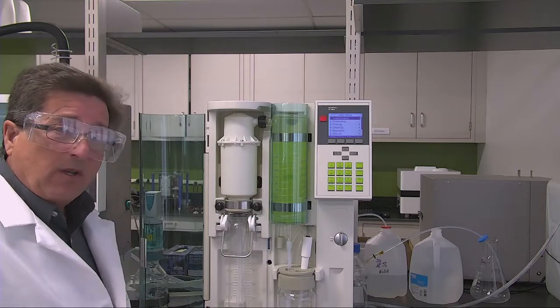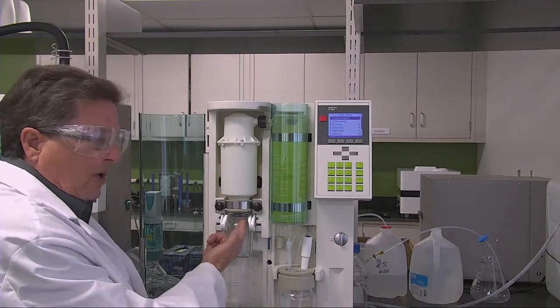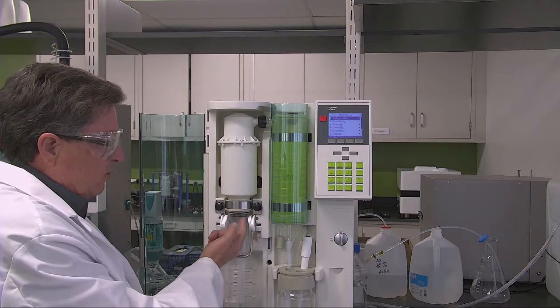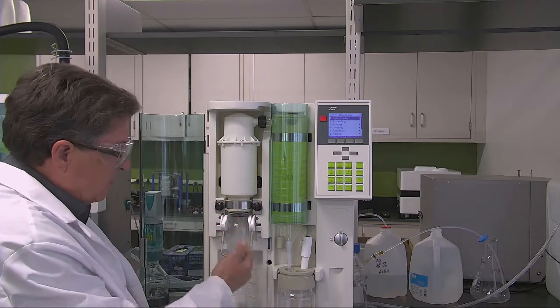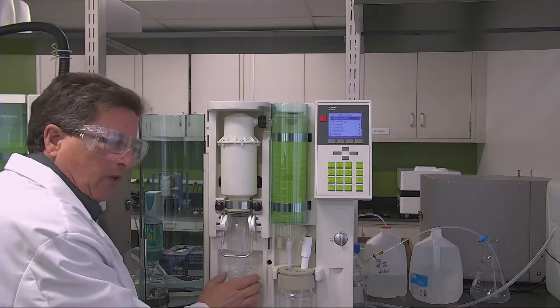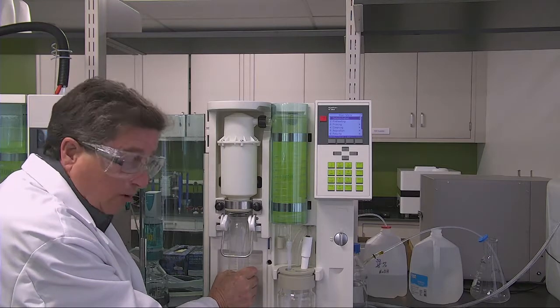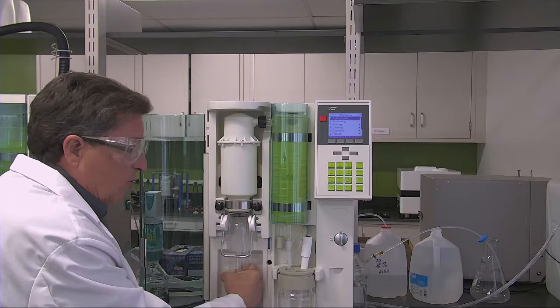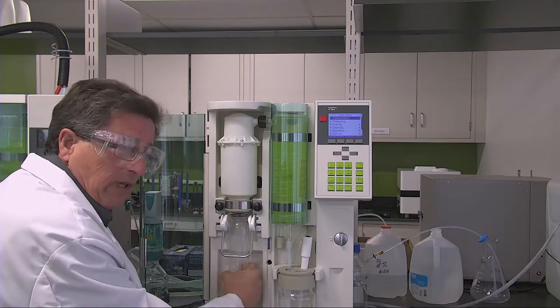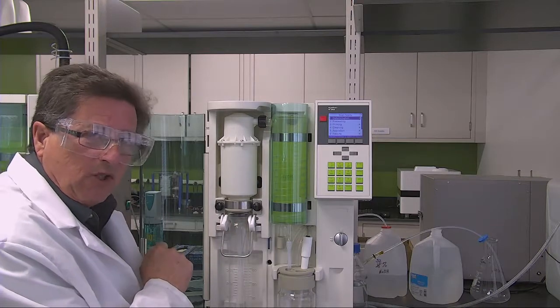The easiest thing to check first is this connection between the sample tube and the splash guard called the bung. The easiest way to do that is grab the tube while it's cold. Don't try a hot tube. Grab the tube while it's cold and twist it. If you can twist it easily, like I am right now, that bung needs to be changed.